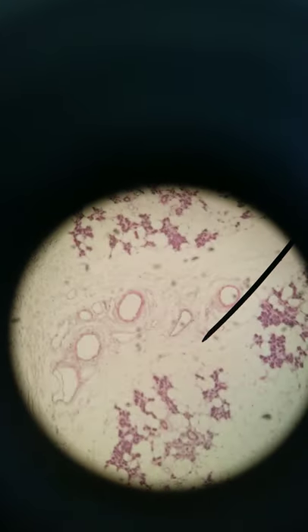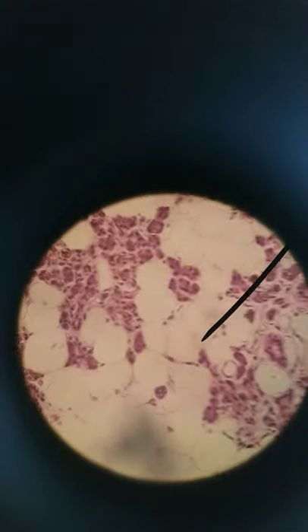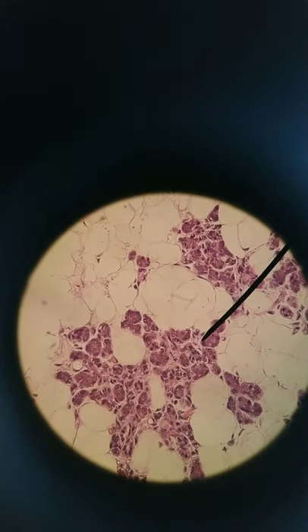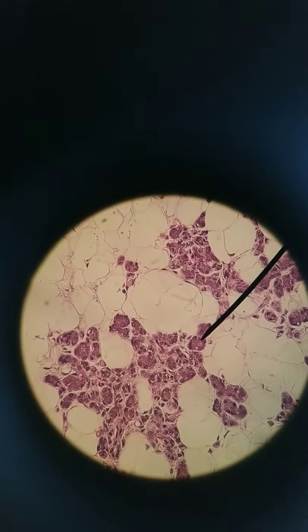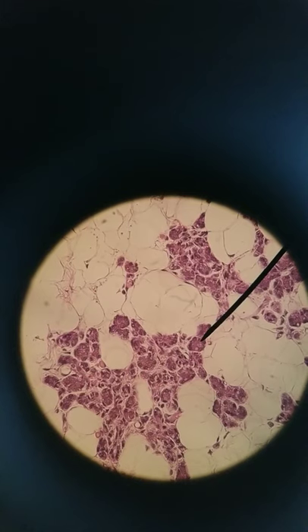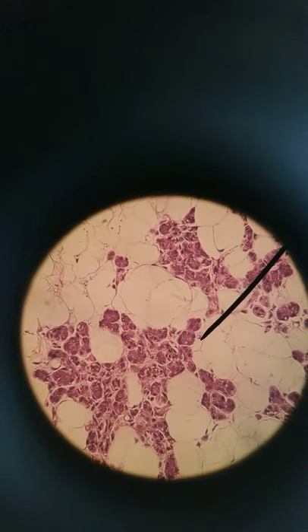At 100x and 400x, this kind of looks like the pancreas in that you've got lots of clusters of cells that form little circles. They're called a similar thing — these are acini. What I'm pointing at is a tight circular grouping of cells called acini. They're simple cuboidal and they secrete some kind of saliva. In between all this lighter stuff, that's adipose — large cells — we're going to ignore that for now because that's not special to the salivary glands.